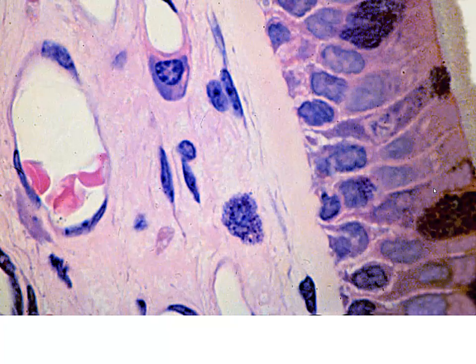More cells once again. This is really nice because you can see the red blood cells inside this blood vessel. We've got our fibroblast. Here we have our epithelium, pseudostratified columnar. With this stain, the goblet cells and the mucin granules are staining dark. And there you can see the ciliated border on these. That dark line, that's going to be our basal body layer. Here we have another plasma cell with a clock face nucleus.